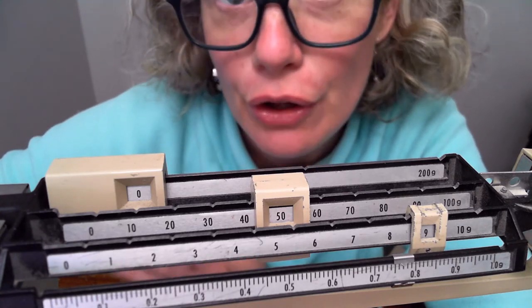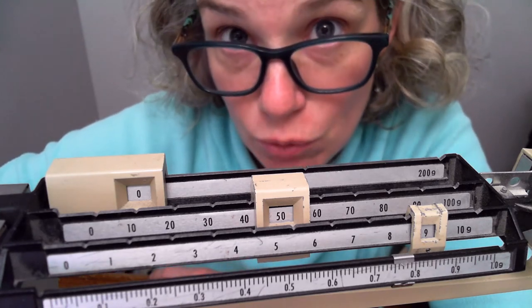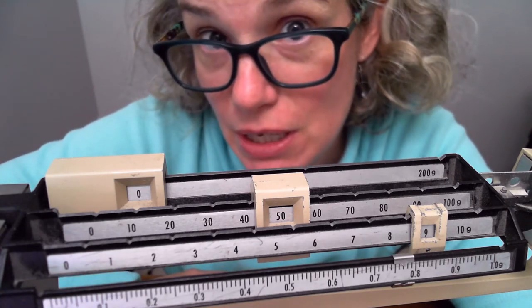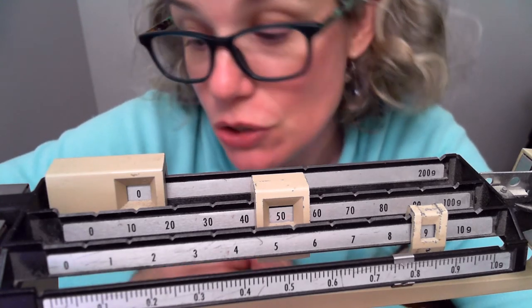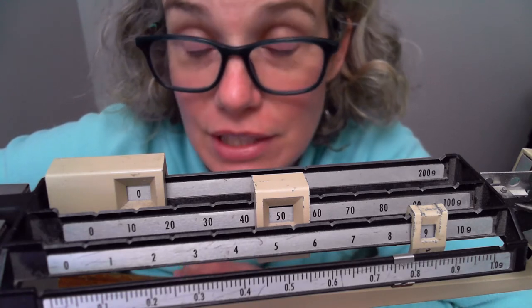A good way to check your answer: I added 30 milliliters of water, and 30 milliliters should weigh about 30 grams, because one milliliter of water weighs about one gram. It won't always come out perfectly due to instrument inaccuracies, but that relationship is a useful benchmark for checking your work.